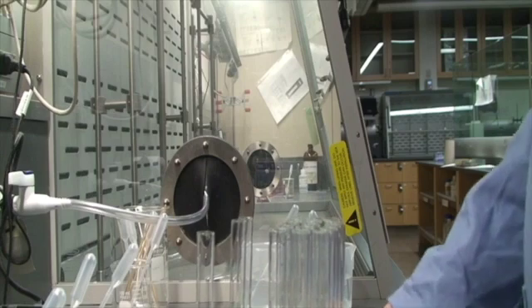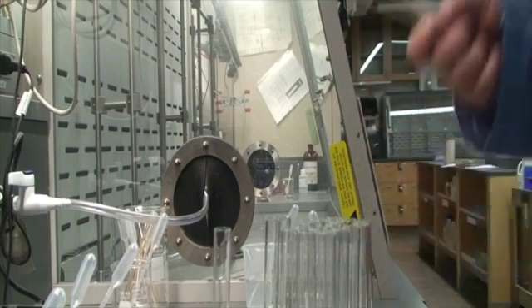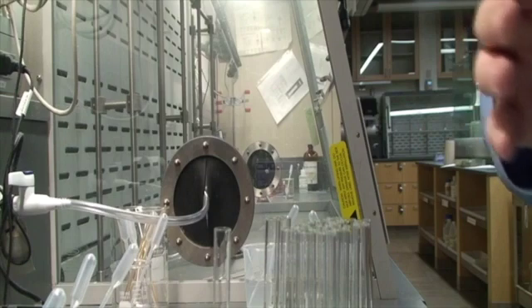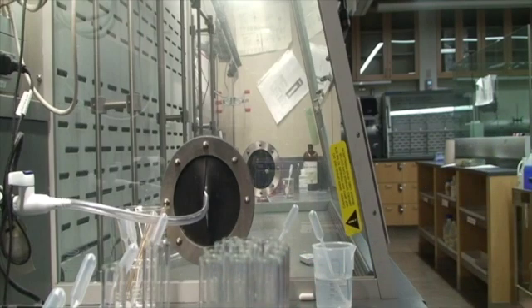So now we're going to skip right to looking at the unknown. You're going to do some summarizing and planning, and then come up with a few reactions that will definitely let you know if there is each of the ions: sodium, strontium, magnesium, and ammonium.